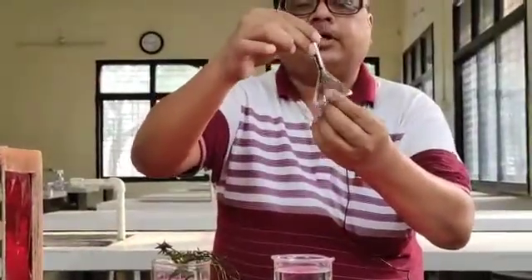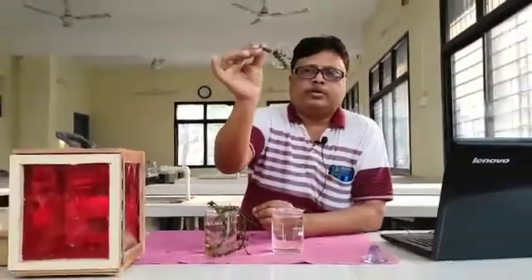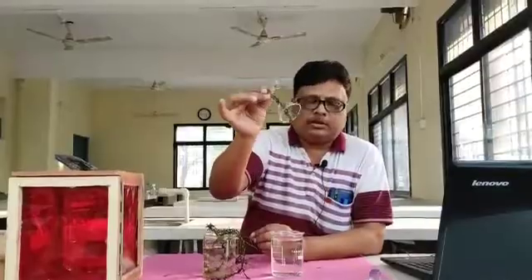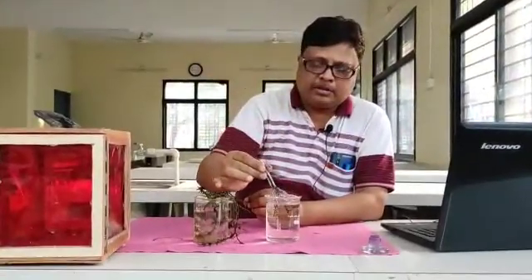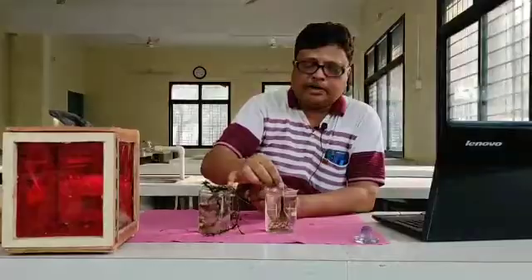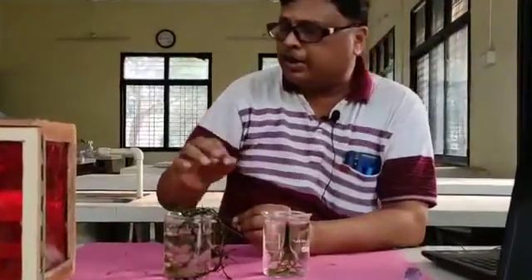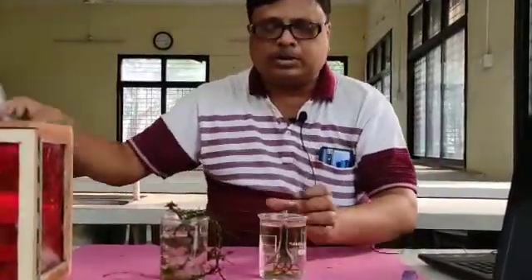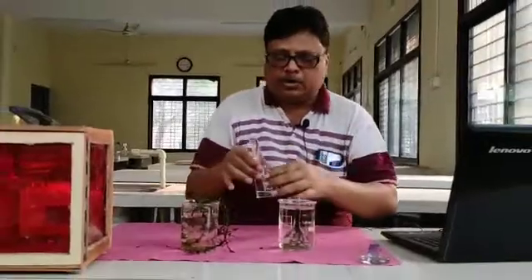This is the inverted funnel. We have put some hydrilla twigs there. Now insert this hydrilla twig along with the inverted funnel into the beaker containing water. This is the beaker that contains the water.